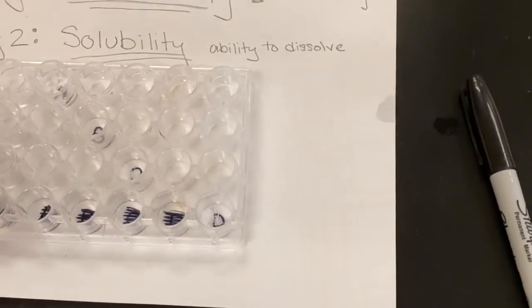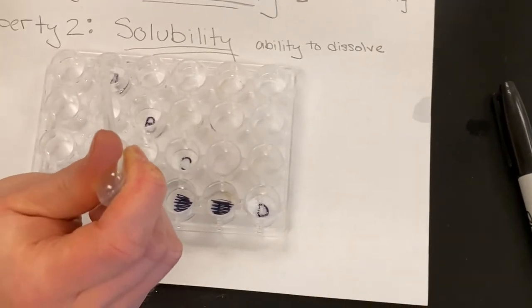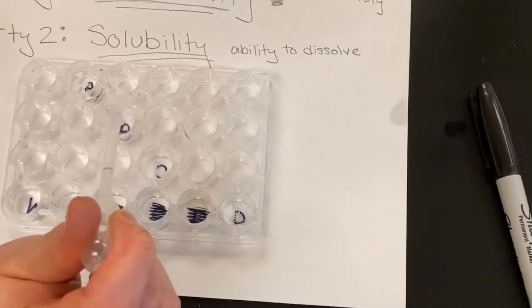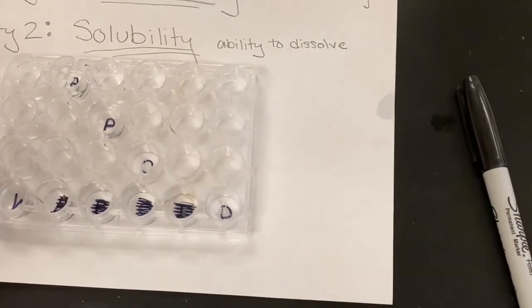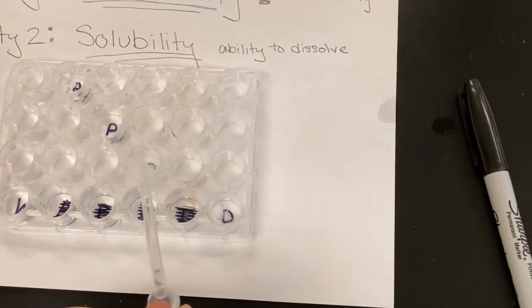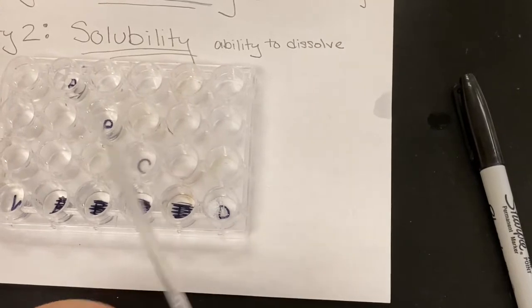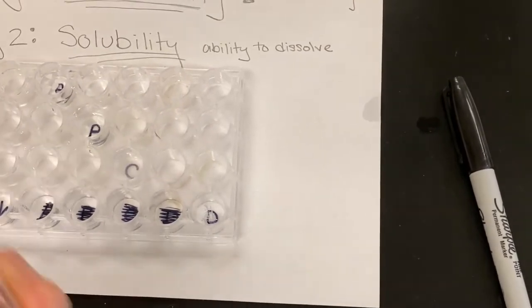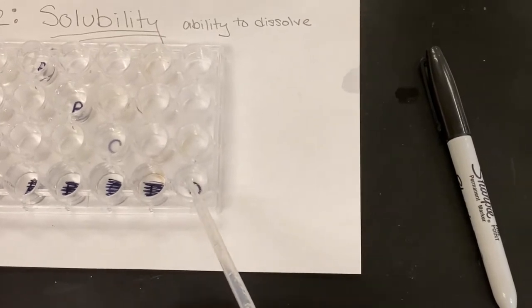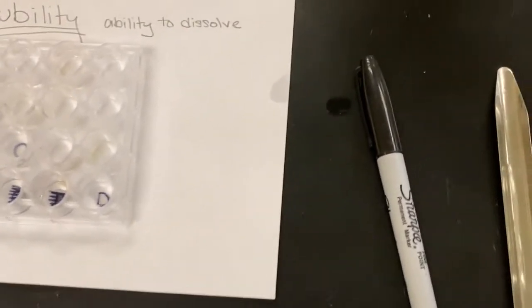All right, so you're going to fill them just halfway up with some water. If you don't put your dropper in the fluid, then you can just keep on using that same dropper. Remember, cross-contamination is something you want to watch out for during this part of the lab. Okay, so I'm not actually putting the dropper into the water, just putting enough in there to get it to dissolve. And the less solid you add, the better in this case.